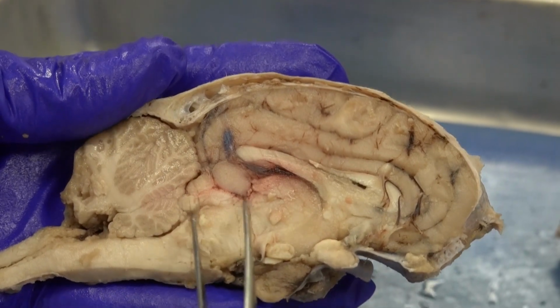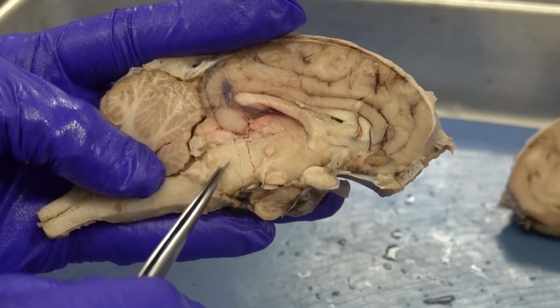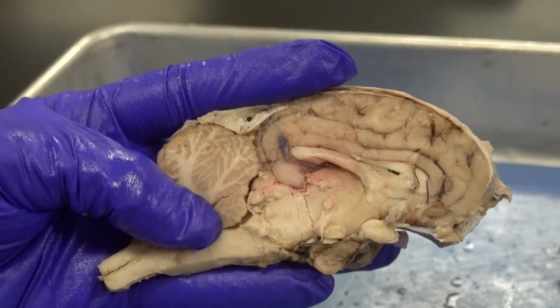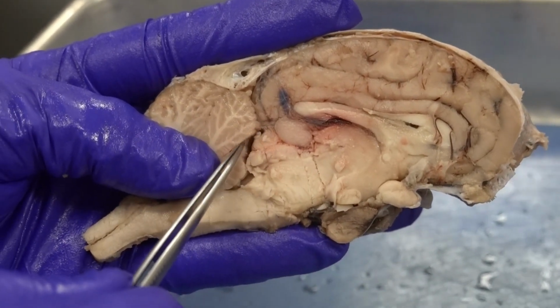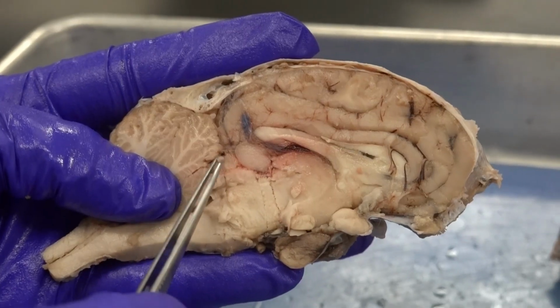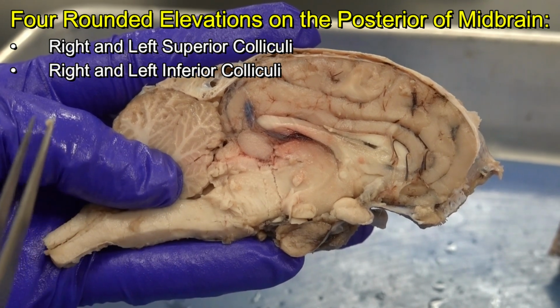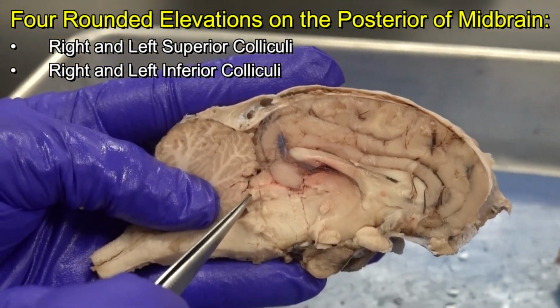When I get to the midbrain, I notice on the posterior of the midbrain, I have two elevations. So I am pointing at these two elevations. We have actually 4 of them. That's 1 and that's 2. These are the left superior and inferior colliculi. That would be the left superior colliculus. This is the left inferior colliculus.